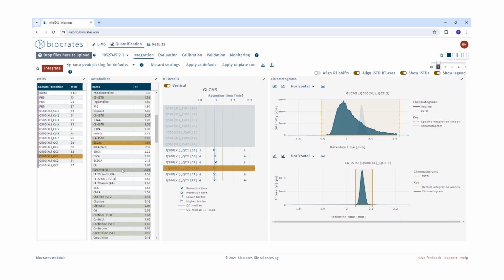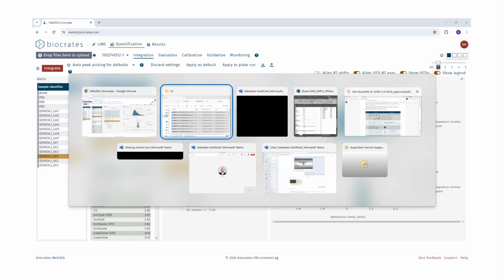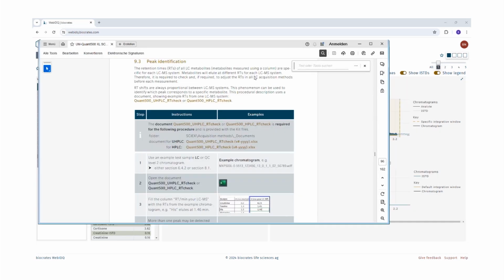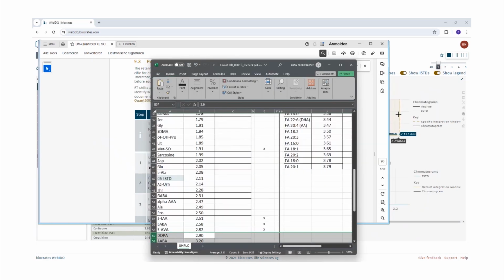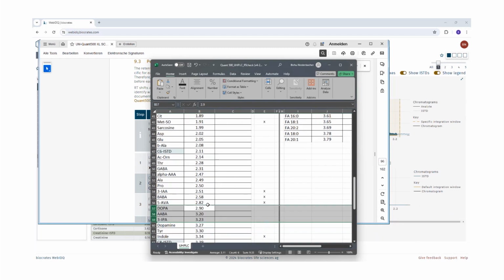So after applying auto peak picking and checking all the confidence indicators, if you are still uncertain, follow the respective kit user manual, specifically the peak identification section, or check the example RT data sheet to estimate the retention times for your instrument.